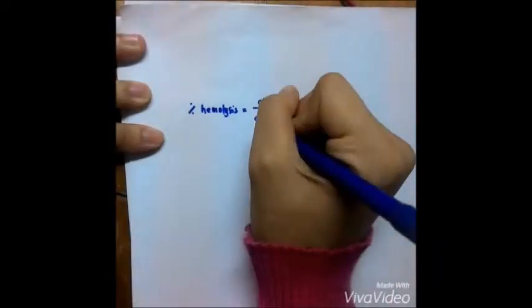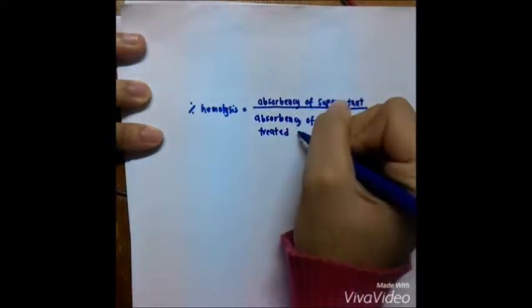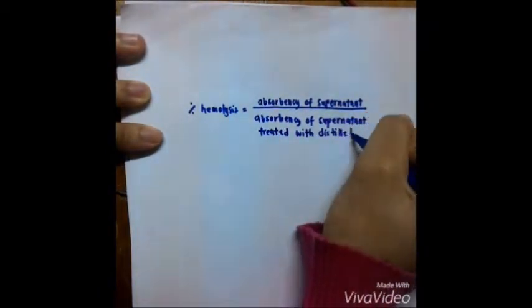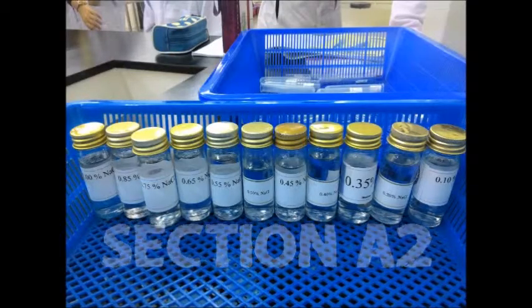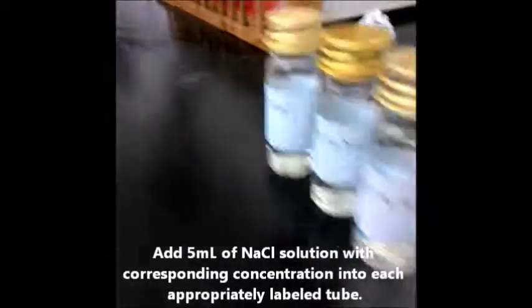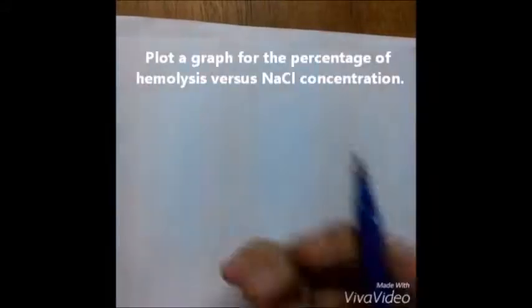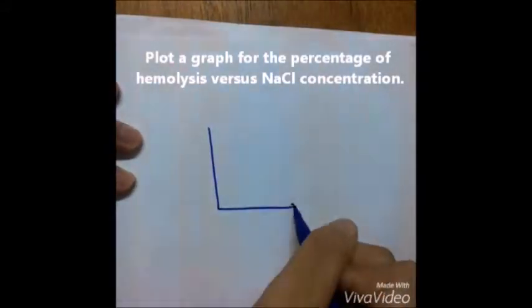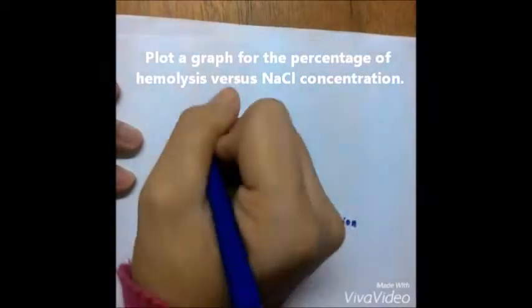Percentage hemolysis is equal to the absorbance of the supernatant over the absorbance of the supernatant from the tube treated with distilled water, times 100. Plot the graph for the percentage of hemolysis versus NaCl concentration.